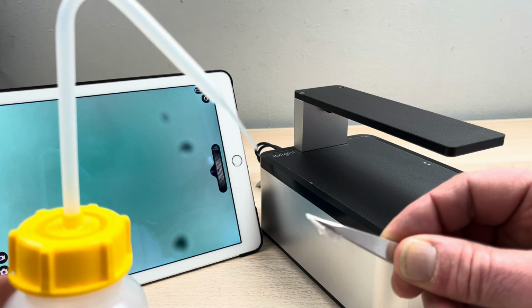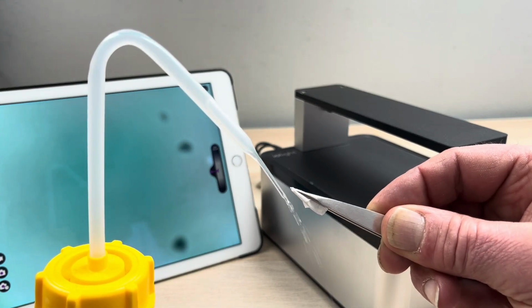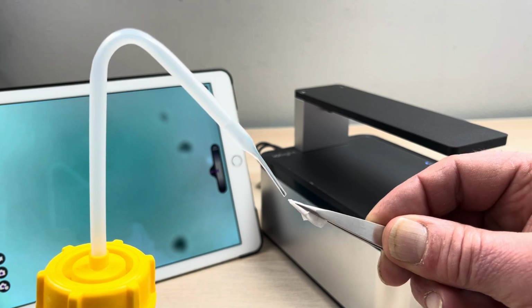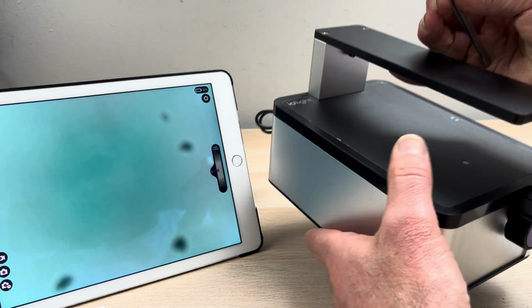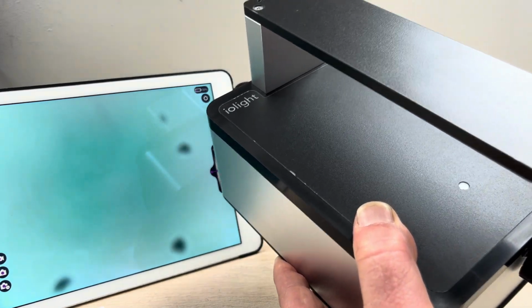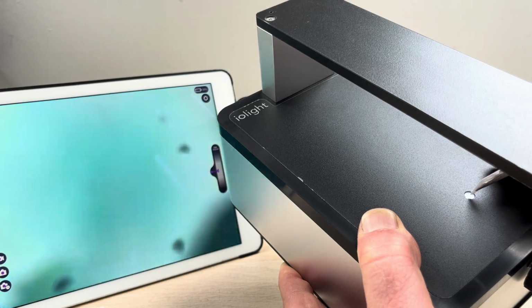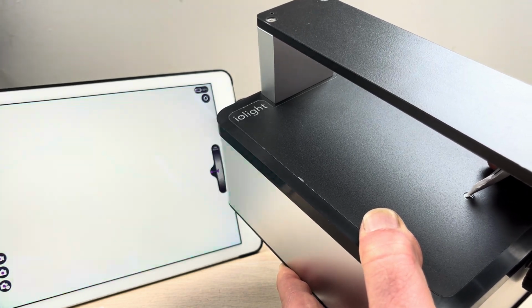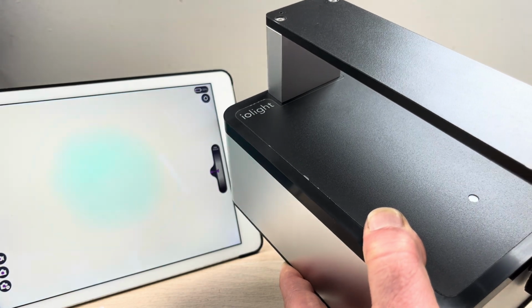I then get some alcohol. I put literally one drop. This is going to be hard to do. Oh, dear. One drop of alcohol on the end just to get it a little bit moist. I can then pick up the microscope. Here's the window. So I've now got my little point of tissue. I start in the middle, spiral around from the middle to the outside.